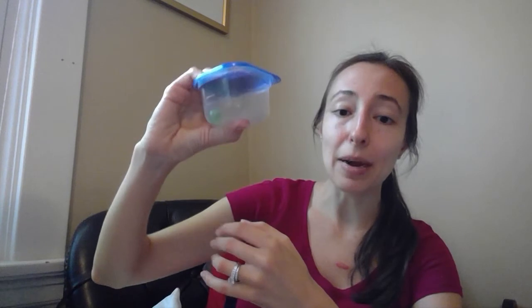Once you don't really hear that marble as you're shaking it, then you can stop and take a look. It'll take probably 5 to 10 minutes. I'd guess closer to the 10-minute, maybe even 15-minute side if you have a really big container. You will have heavy whipping cream halfway up in your container. I do not, but you want to have part of your hand on the top and part of your hand on the bottom, just so that it doesn't open up and spill.